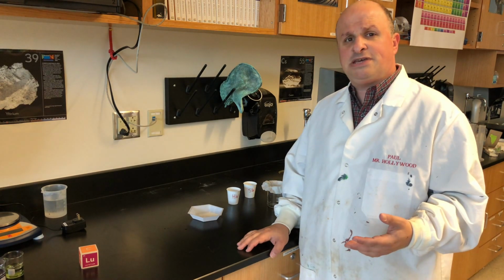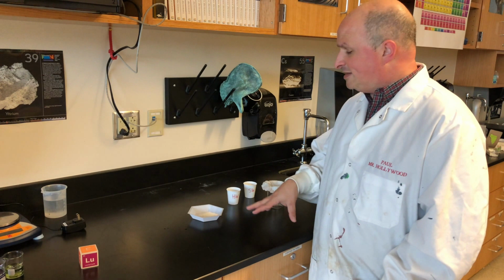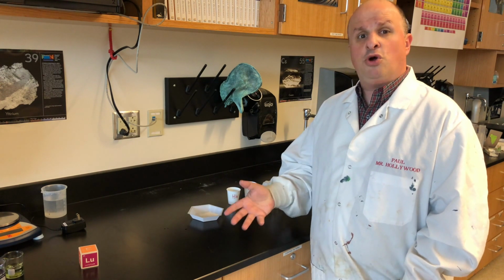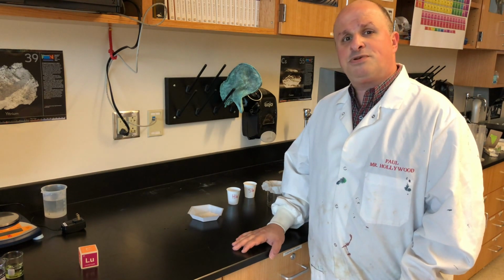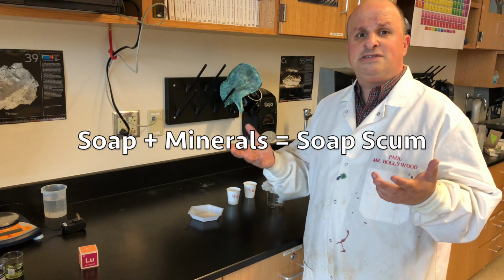We're going to create a precipitate in two ways today. One, a demonstration that I'll show you during class, and the other you're going to do right here using some equipment. So you may have heard of a substance called soap scum. It gets mentioned a lot in cleaning ads for different products. Soap scum is a precipitate that's made from soap and minerals in the water.